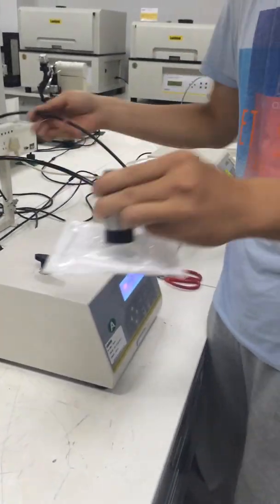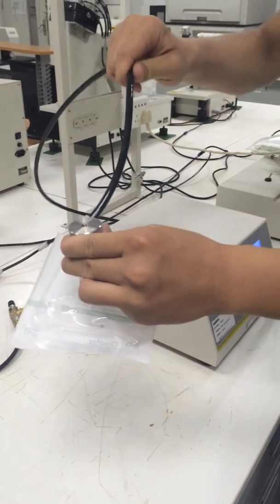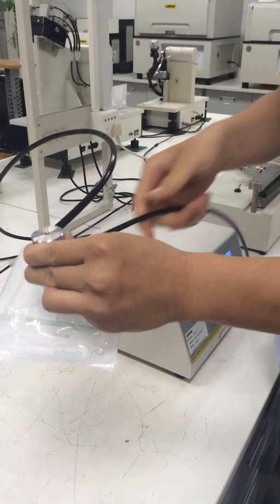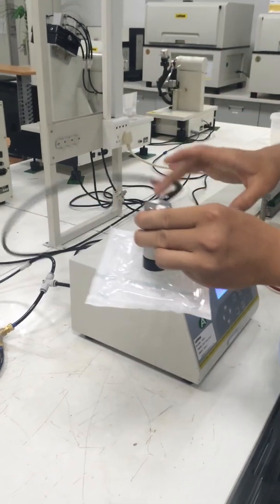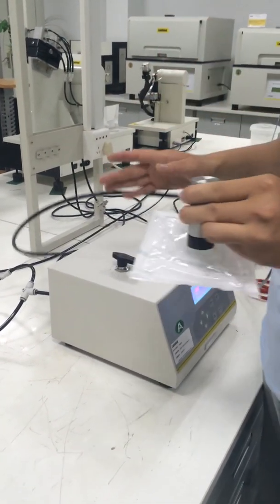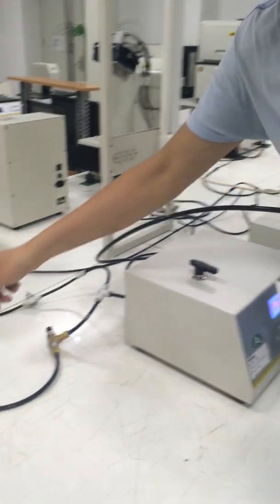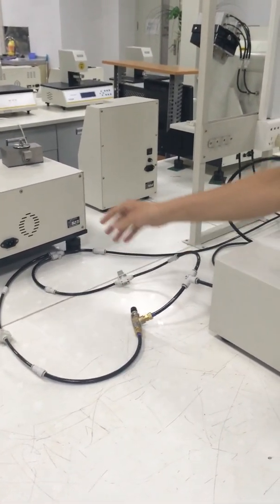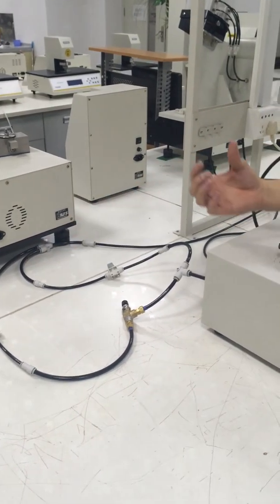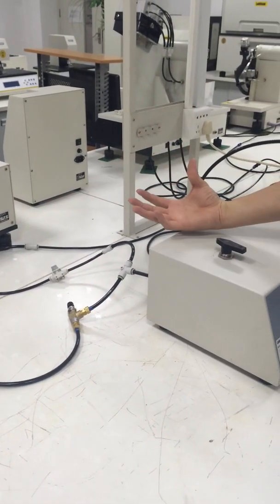This is the pressure output with the gas pipe going back to the sensor. If we want to perform a burst test, we switch off this one and switch on this one, so the flow rate will be big enough to perform the burst test normally.